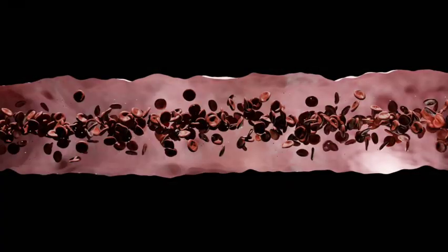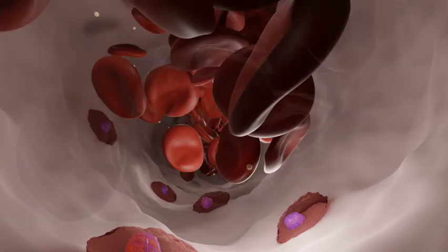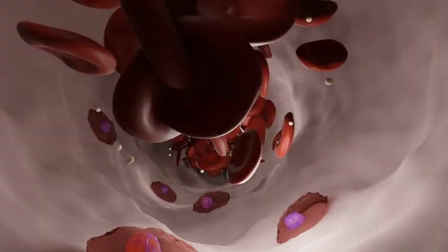The vasculature serves as a conduit for the transport of red blood cells, carrying oxygen around the body. Due to their biconcave shape, red blood cells flow down the central line of a blood vessel. As a parasite matures within an infected red blood cell, the cell loses its biconcave shape and becomes rigid. The deformation causes the infected cell to be pushed out to the walls of the blood vessels by a process called margination.